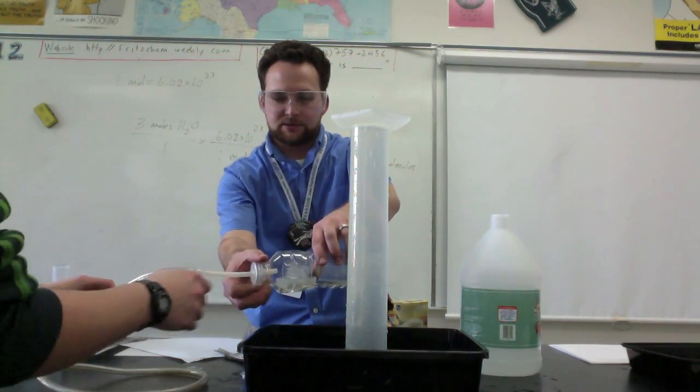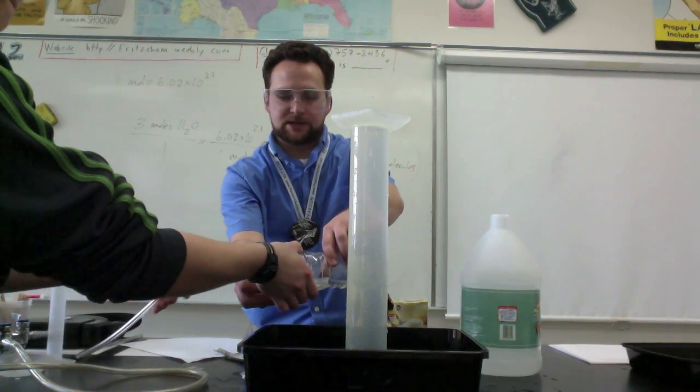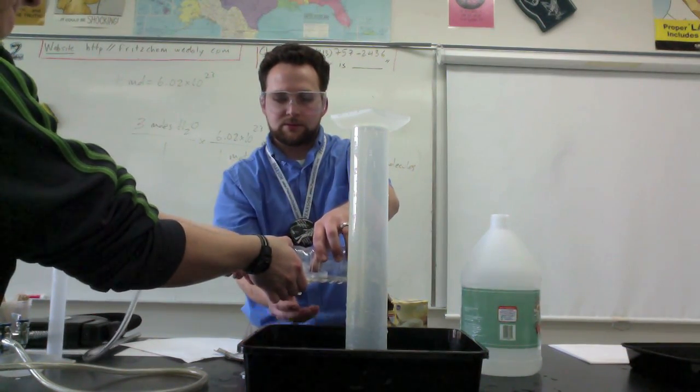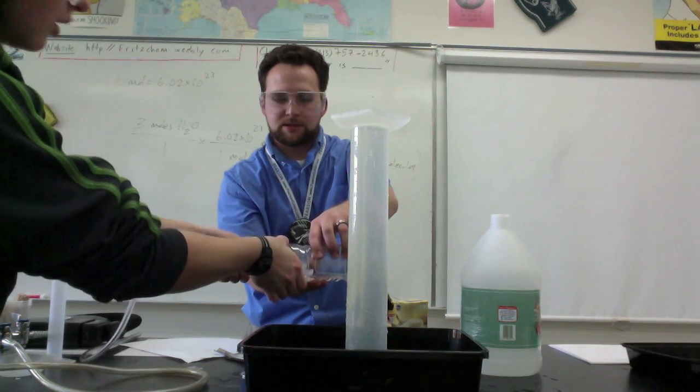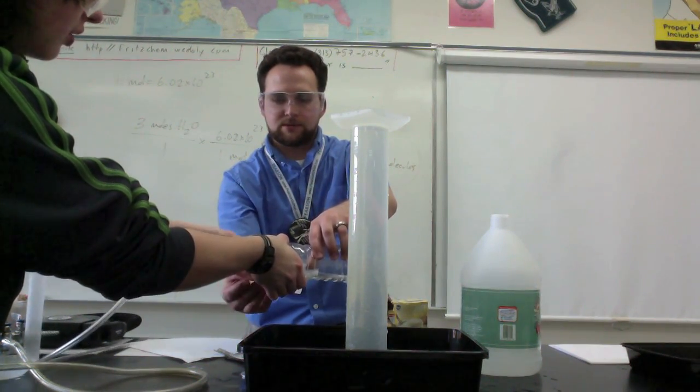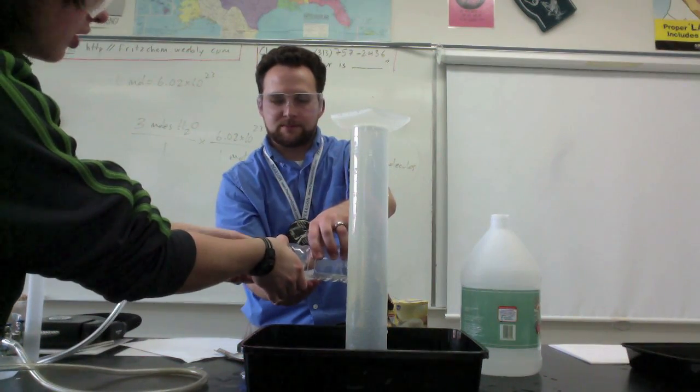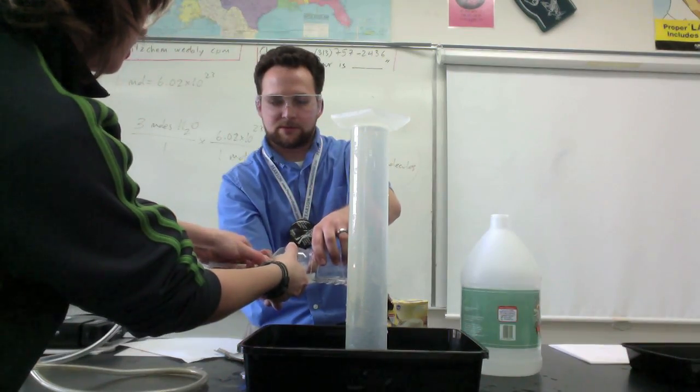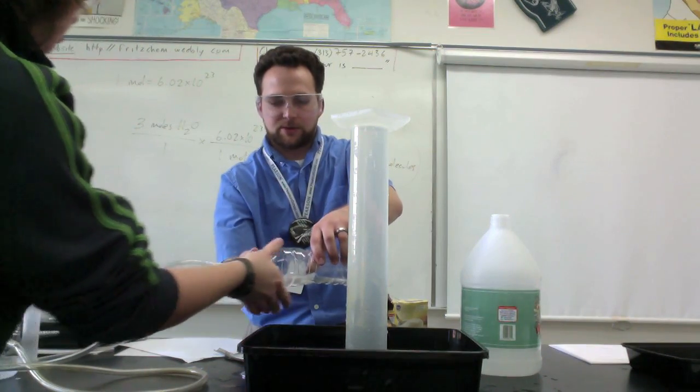So Grace, if you want to screw that on there while I hold it steady, just make sure it's tight. I'm pretty tight. Oh, other way. Oh, it wasn't lined up. Let's see, it's good, is it good? Okay, all right, cool. So now we got it on there tight.